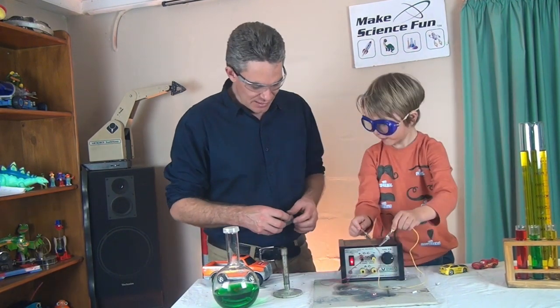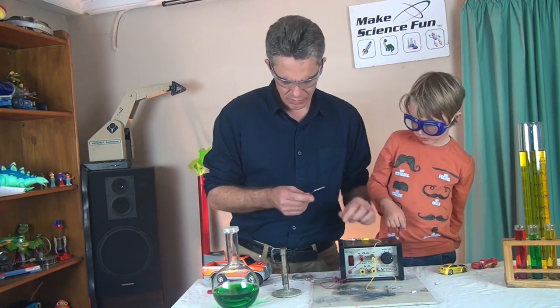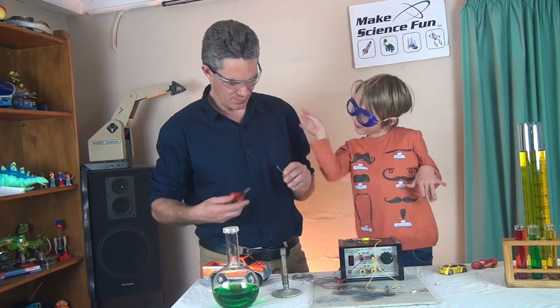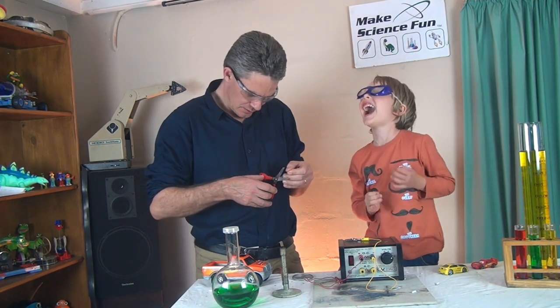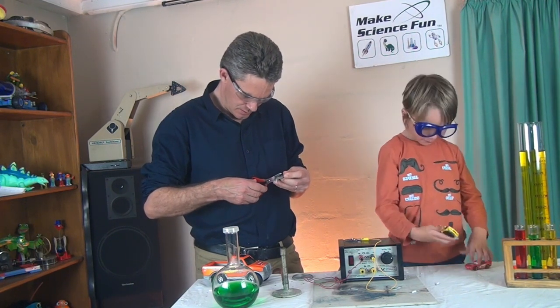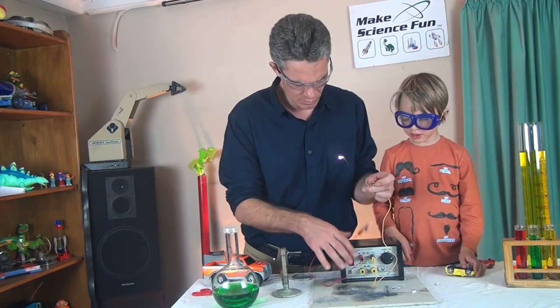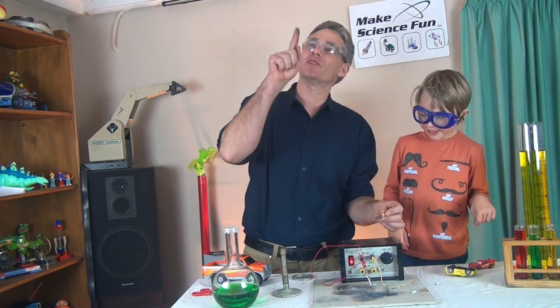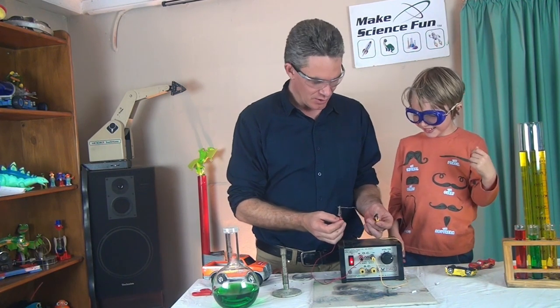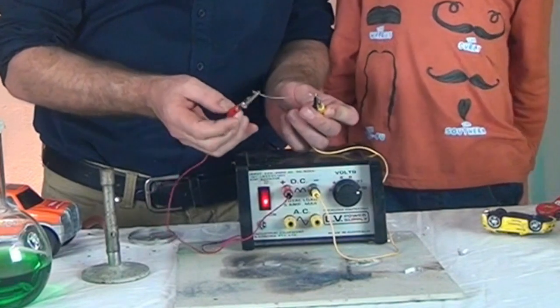What about if we try some magnesium ribbon, Sam? Okay. We'll try a really thin little piece. Look. Whoa! Oh, look at the little smoke ring. Did you see that, Sam? Yeah, it made a green light. Do you have your goggles on? Let's try again. Wow. It made a fire noise.